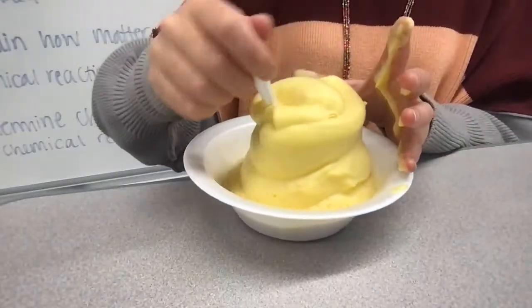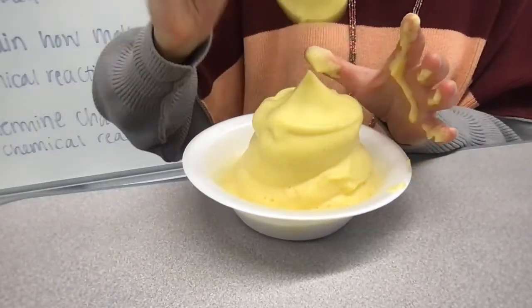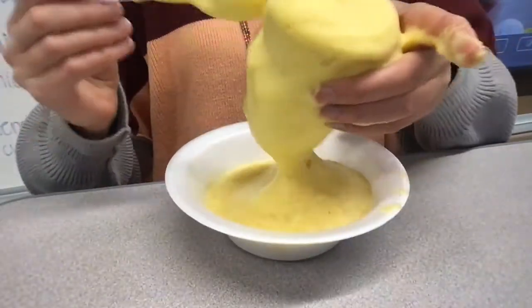Okay. So continue on. Here's some nice fluff. It's fun to play with. Okay, so again, it's very warm.